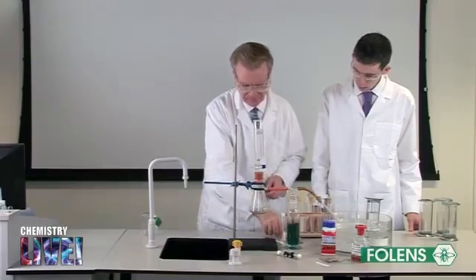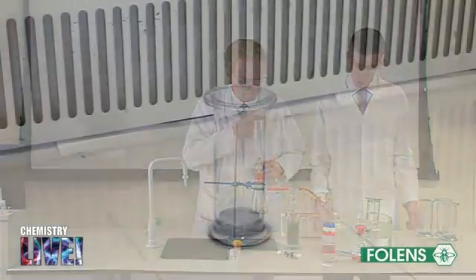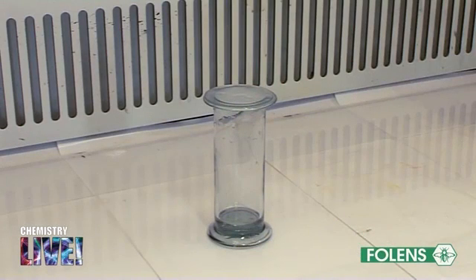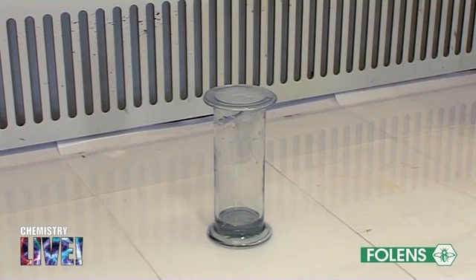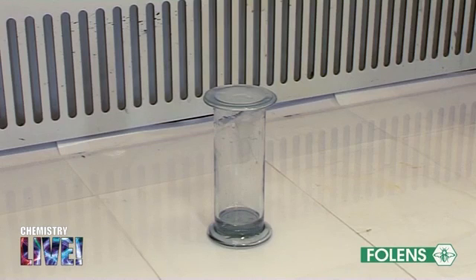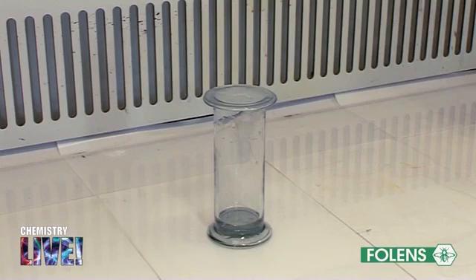In the next part of the experiment, we will carry out a number of tests on the gas. Note the physical properties of ethyne. It is a colourless gas with a smell. If impurities are still present, it will not smell very nice. Like methane and ethane, ethyne is insoluble in water but soluble in organic solvents.